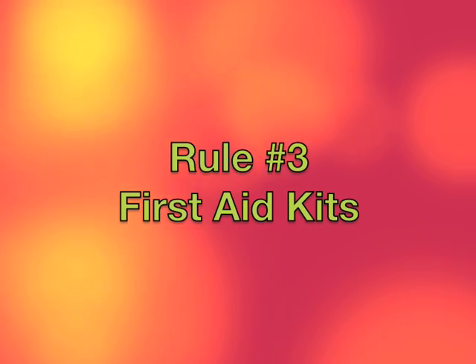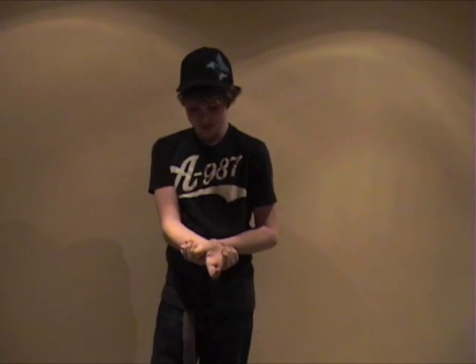Always remember to have a first aid kit nearby and remember where it is. Hey man, I cut myself. Can you pass me the first aid kit? Here, have the first aid kit.